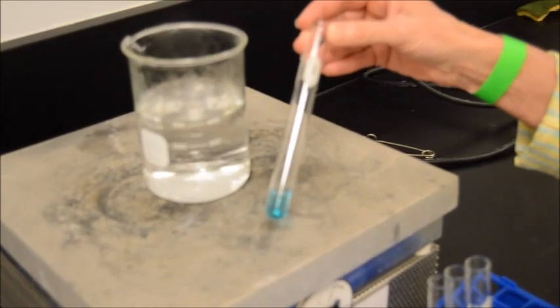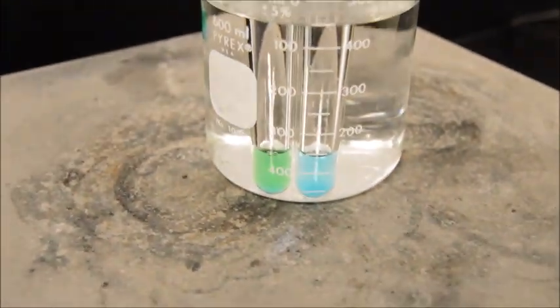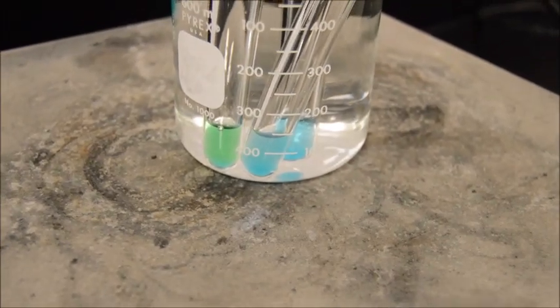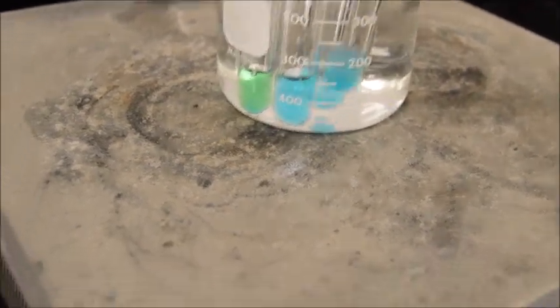We've got our test tubes numbered 1 through 4. We're going to drop those in. You can see that one's nice and blue. This one here has already got a little bit of a weird shift going. We're going to place it in and see what happens. Here comes another one. Stir it up nicely. And there's number 4 going in.